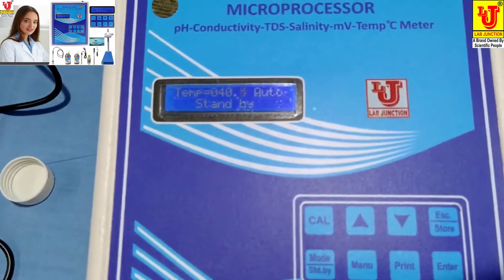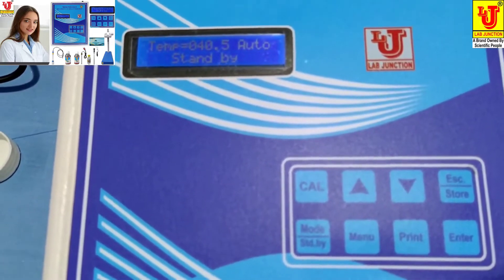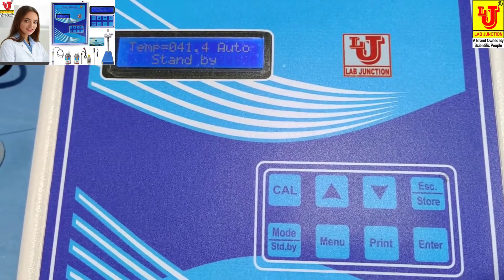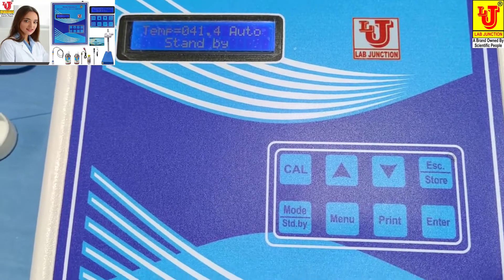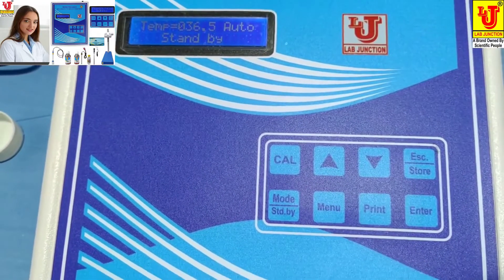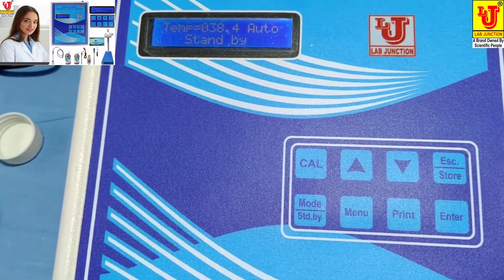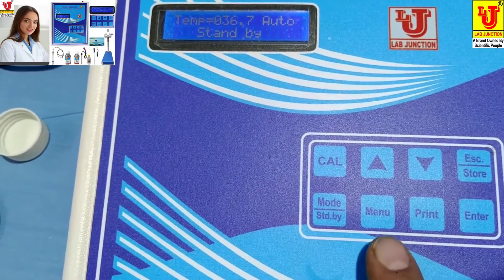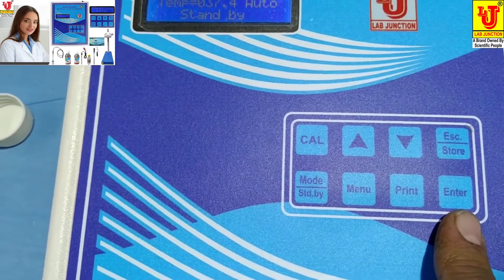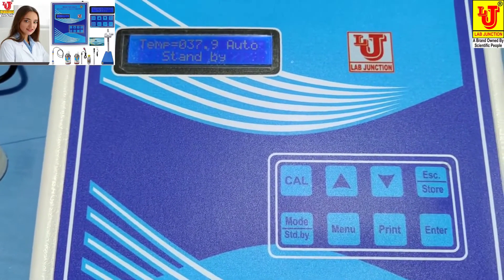The top of the display shows temperature, and the unit is in standby. On the keypad: the CAL key is used for calibration; the up and down keys for navigation; the escape and store key combined in one key; and the mode and standby key. The menu key selects parameters, print is for printing results, and enter is for confirming.